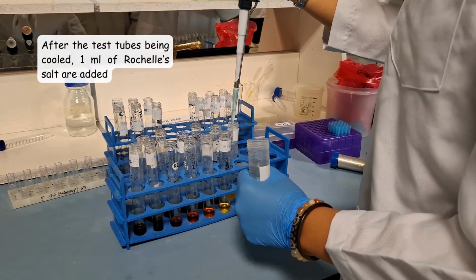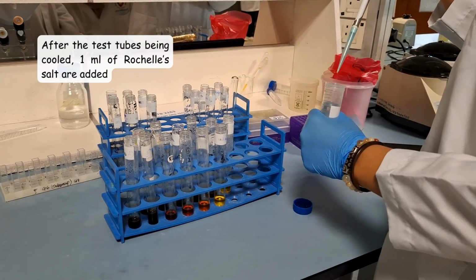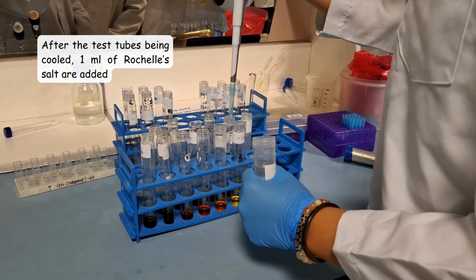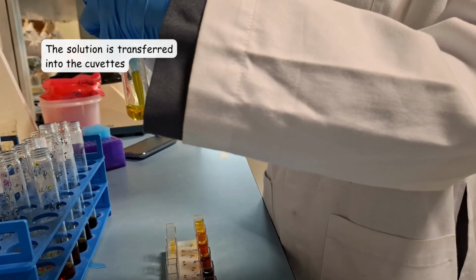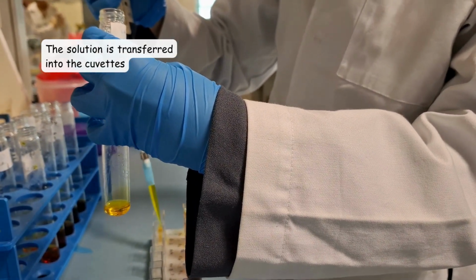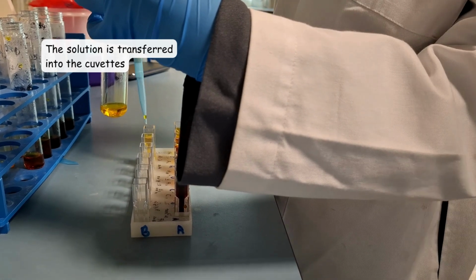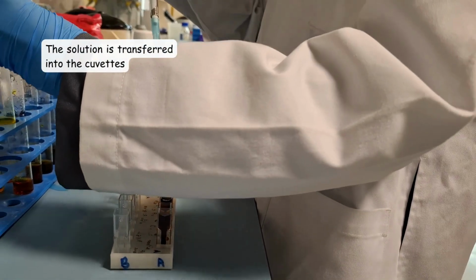Then, after the test tubes are cooled, 1 ml of Rochelle salt is added to impart stability to the color of the product formed. This stabilization is crucial for precise and reliable absorbance readings. Next, the solution is transferred into the cuvettes. During the process, inspect cuvettes for scratches, cracks, or air bubbles, as these can distort absorbance readings. Make sure not to shake or tilt the cuvette roughly after filling to avoid creating bubbles.